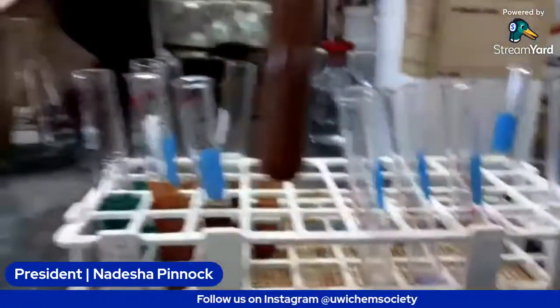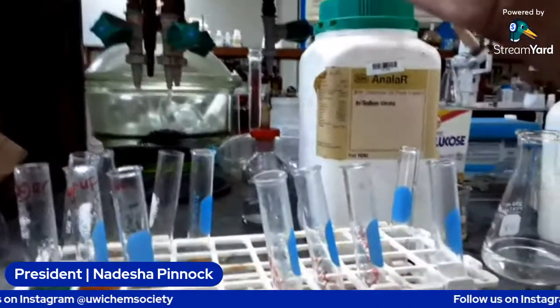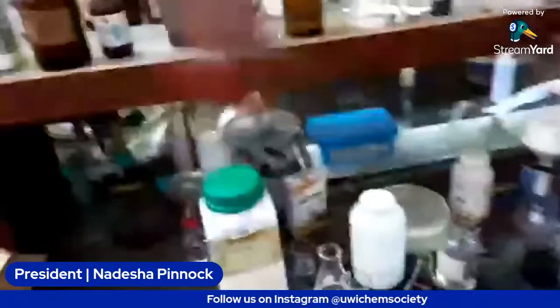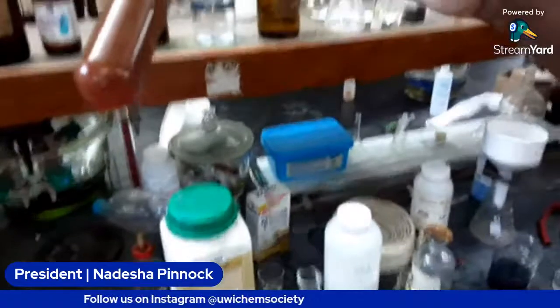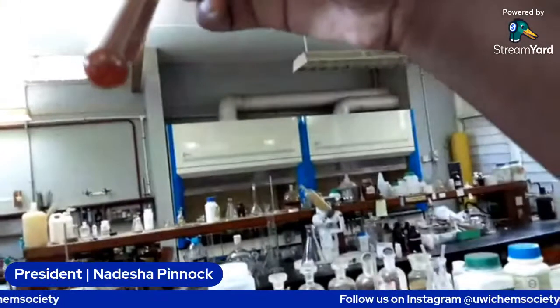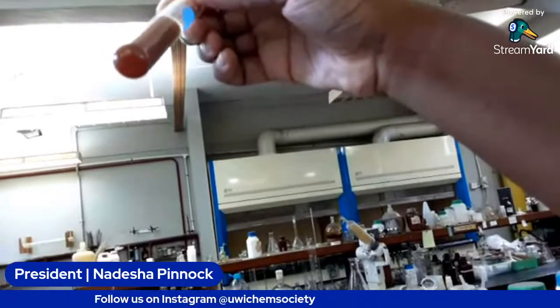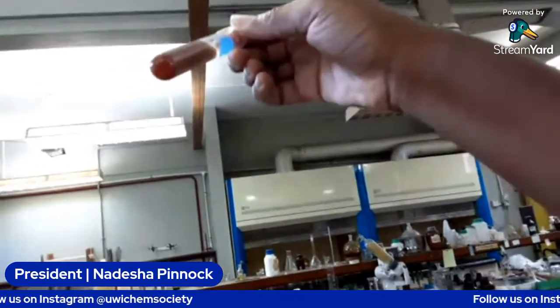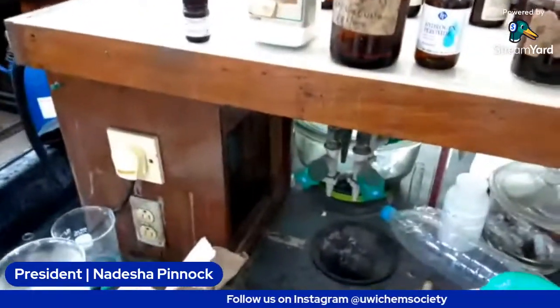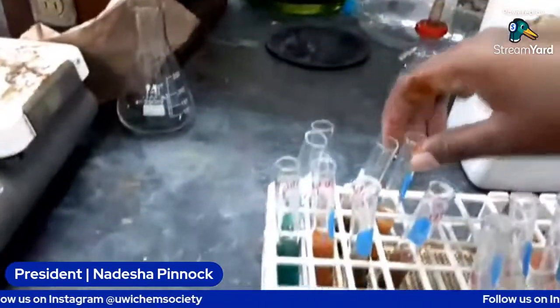This one is the glucose. So this is the brownish looking one that we had, and it has some brick red precipitate at the bottom. Let me hold this up for you guys to see. I'm trying to get the light. There we go. So you can see the brick red precipitate at the bottom of the test tube. So that one is glucose, which is what we had before for the glucose, since we're matching them.